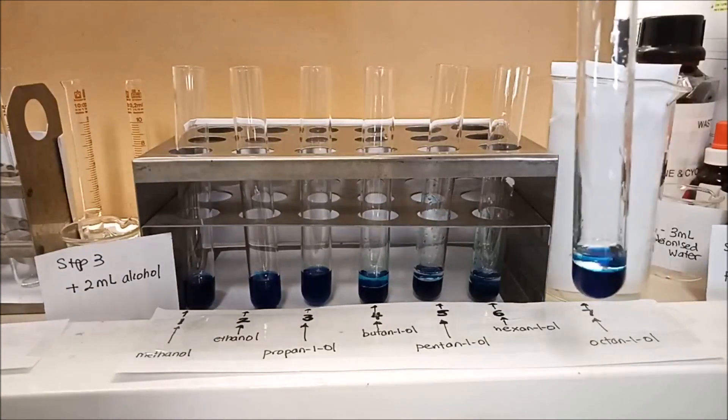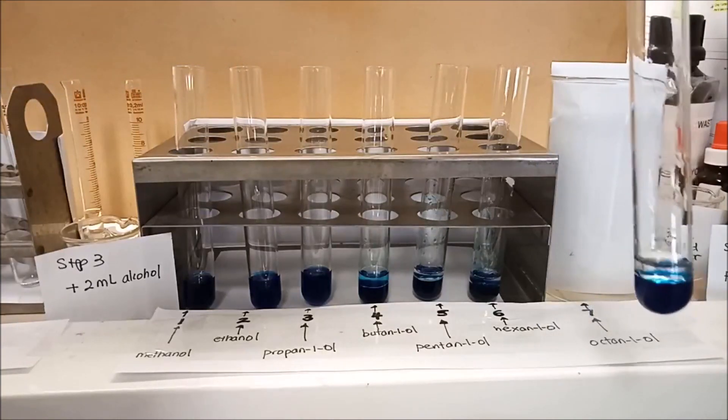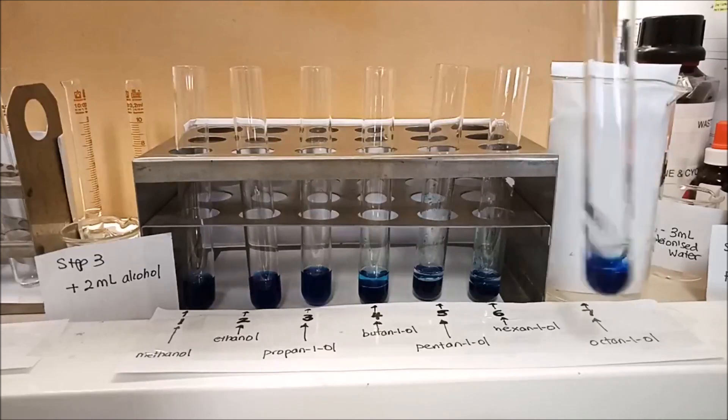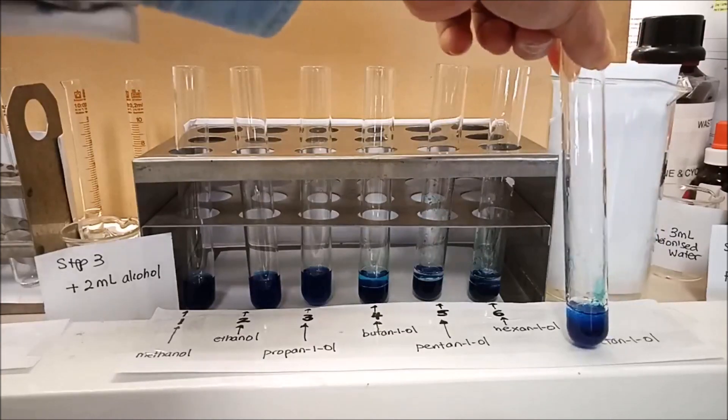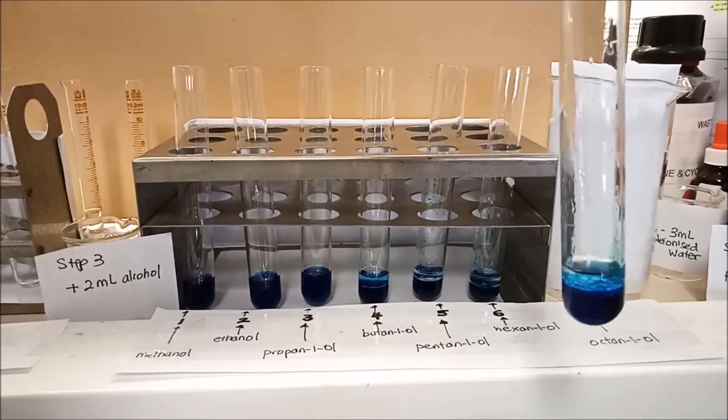It is two layers. You can see two layers here. The bottom layer is water. The two mils of octanol floating on top. It is less dense than water. Give it a shake and see what happens. It turns light blue and it's still on the top layer, not mixing with the bottom layer.